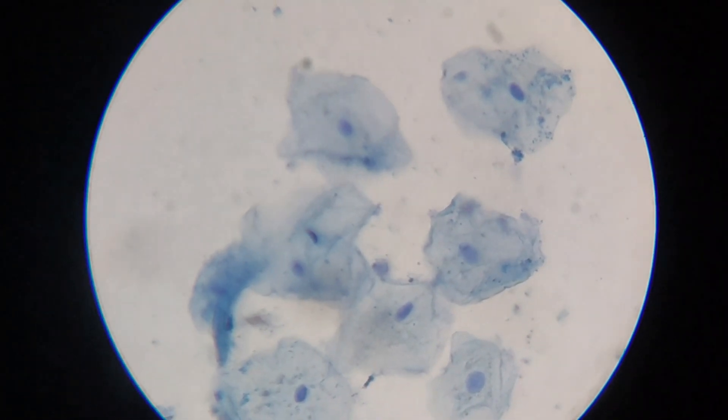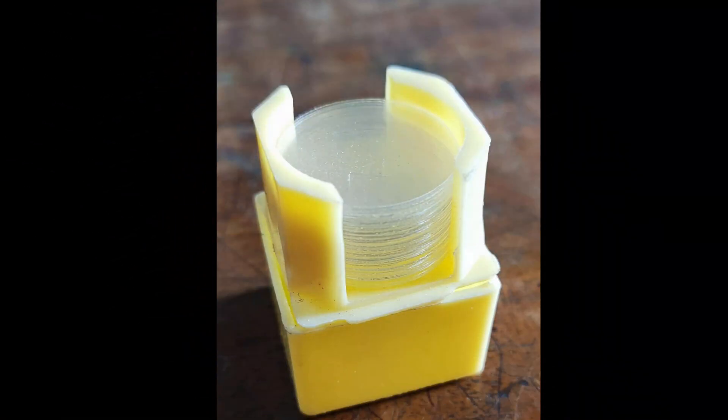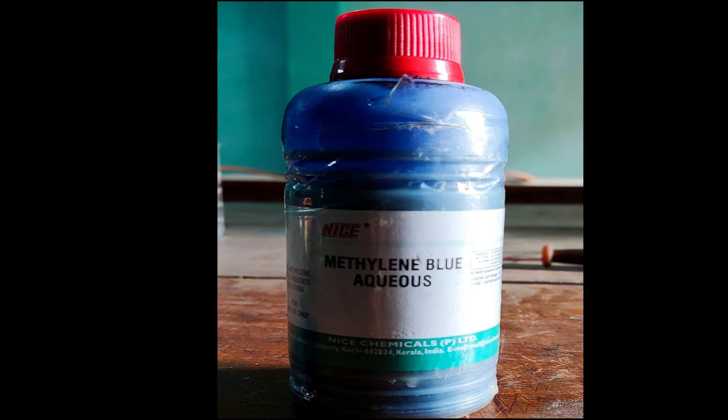To perform this experiment we require a compound microscope, a glass slide, cover slip, methylene blue stain, water in a beaker, dropper, toothpick, forceps, absorbent paper, and a needle.